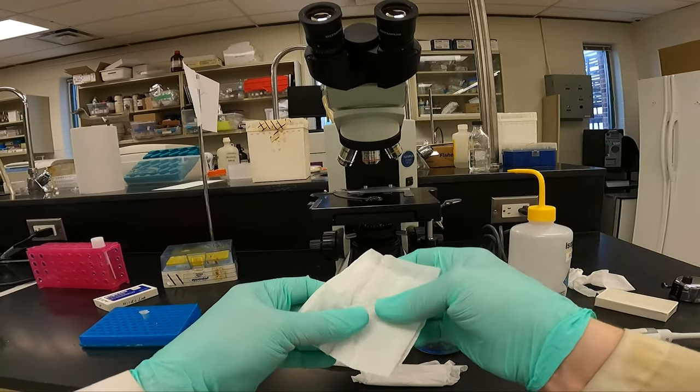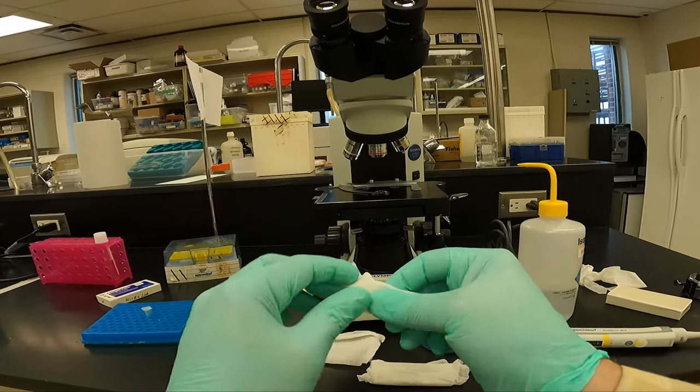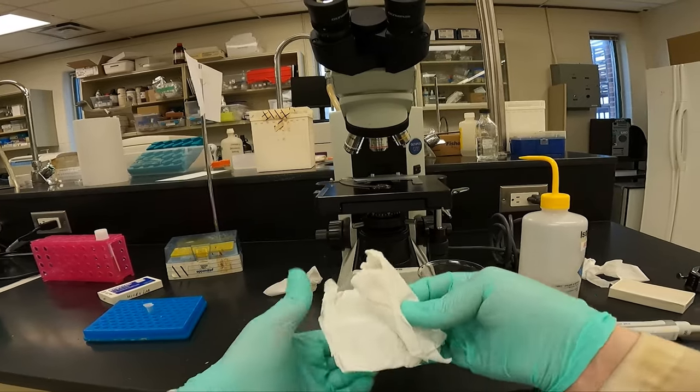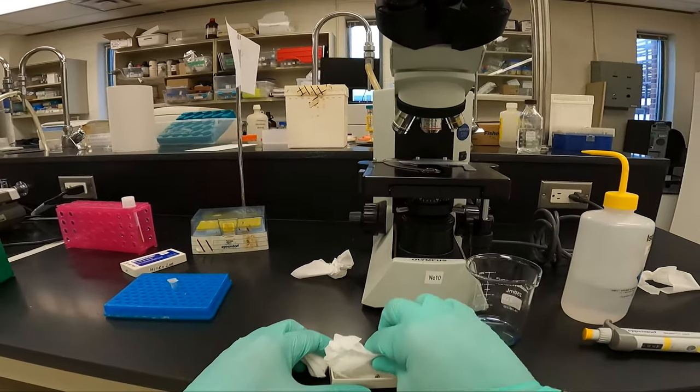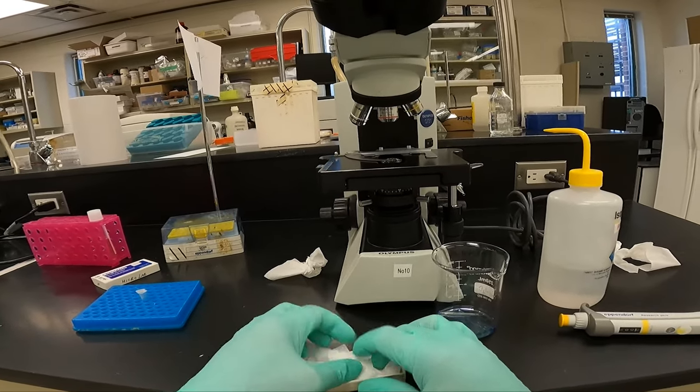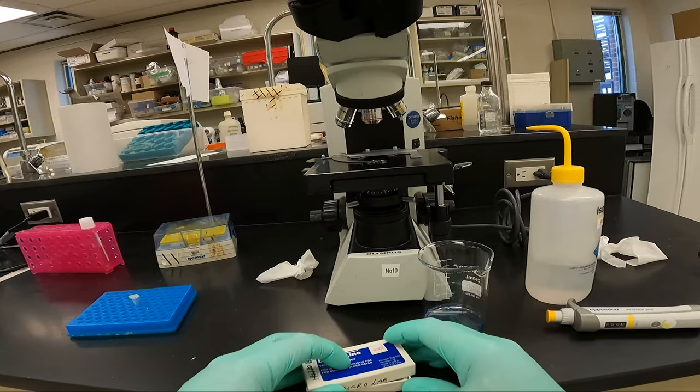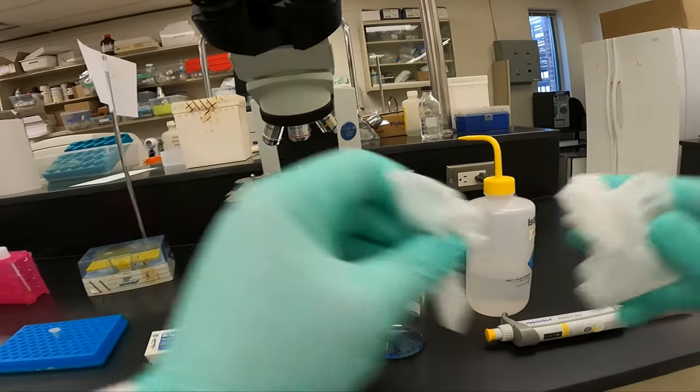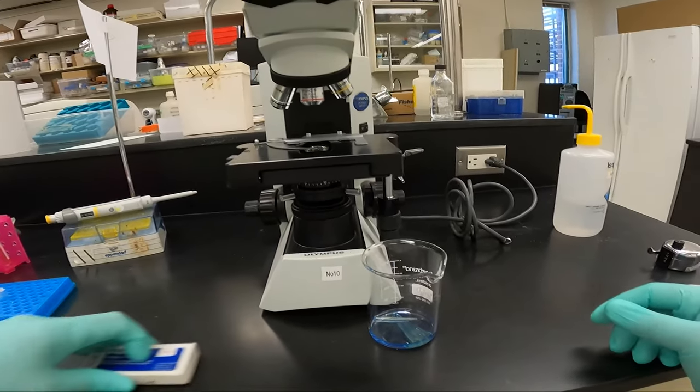Again, it's clear. It can be lost pretty easily, so I wrap it up in a Kim wipe just so it's easy to find later on. Put them back in the box. And tidy up your workspace, putting everything away.